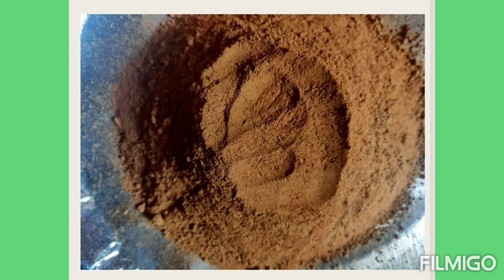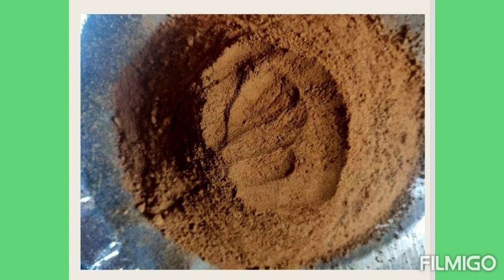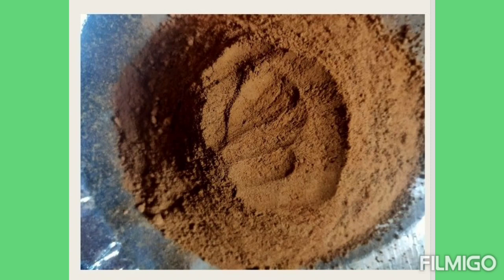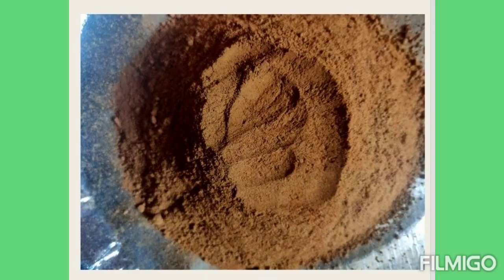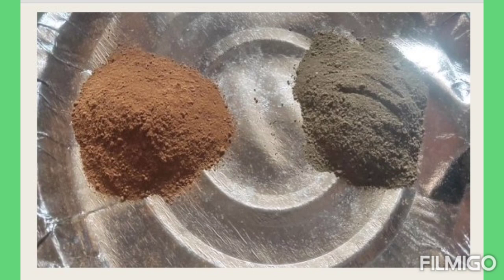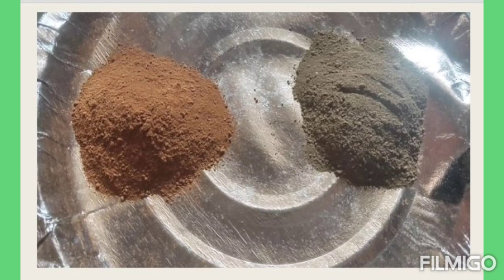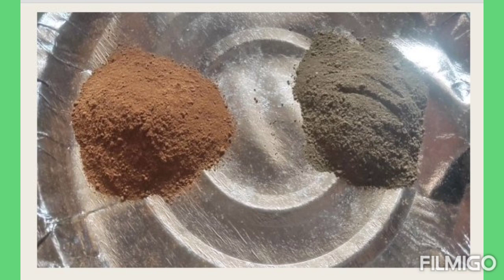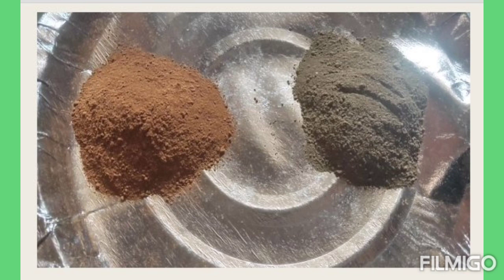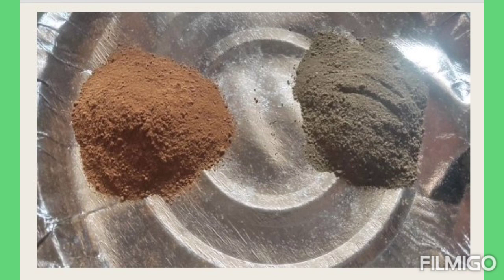You can all see that there are two different soils with two different colors. It shows the color variation of the soil, and in your syllabus there is one experiment related to determination of soil color. You all collected soil from your nearby place, and when you see each other's soil samples, you may get different colors. You can compare them and determine which color each soil has. This experiment completes your one experiment — that is, determination of soil color.